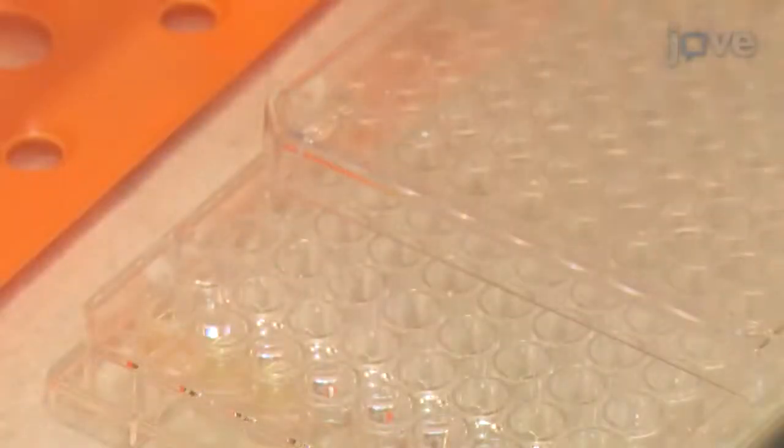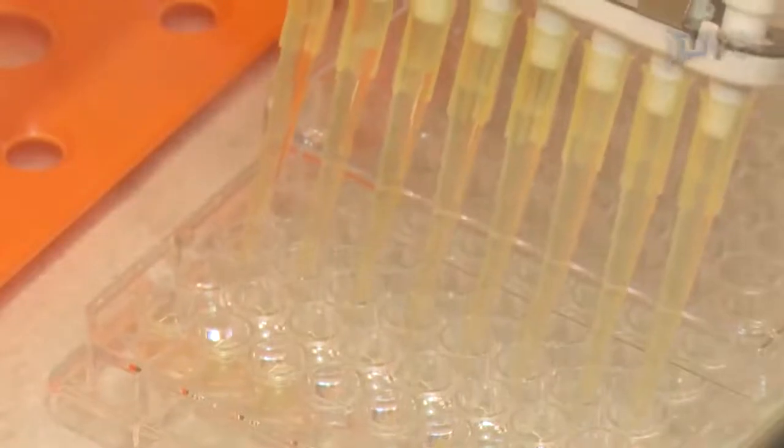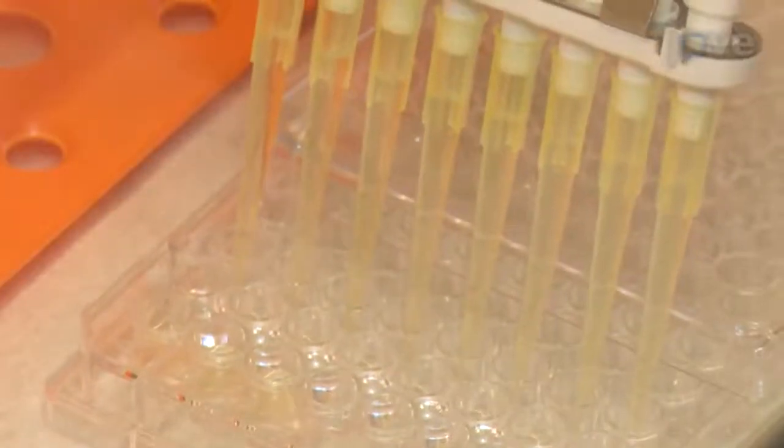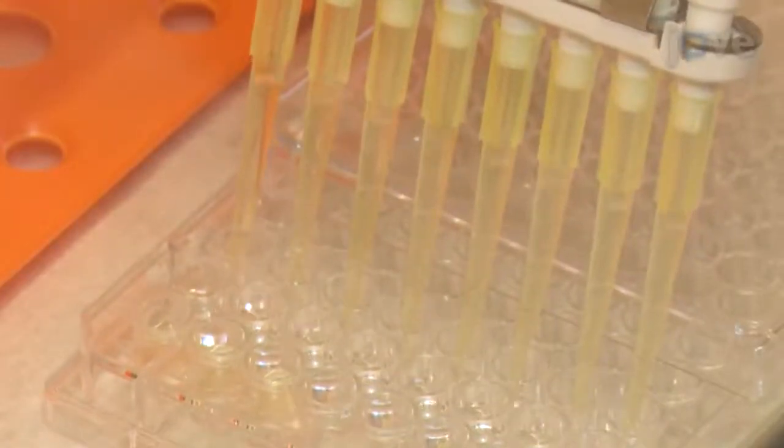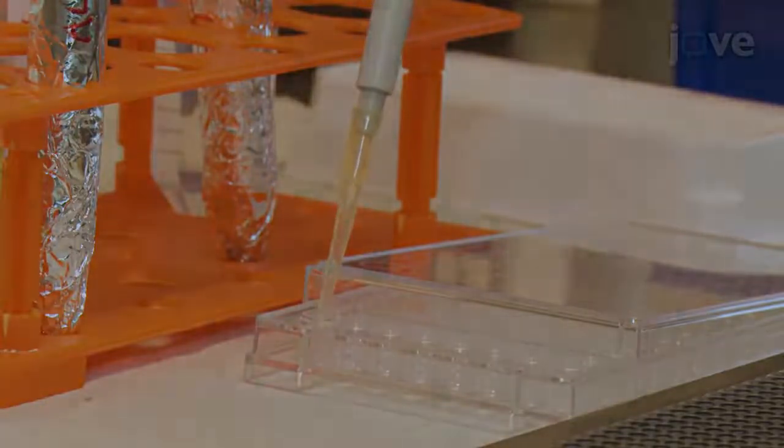The next day, gently wash the wells three times with PBS without disturbing the biofilms. Next, add 200 microliters of freshly prepared ALA.